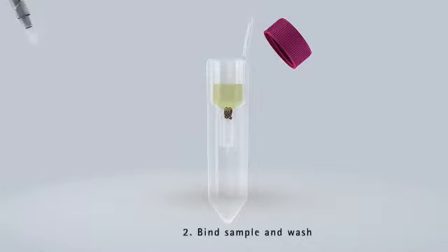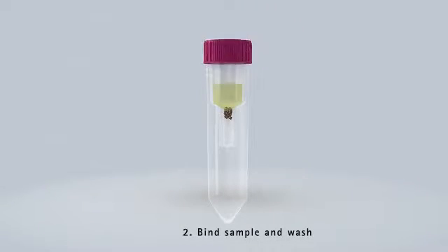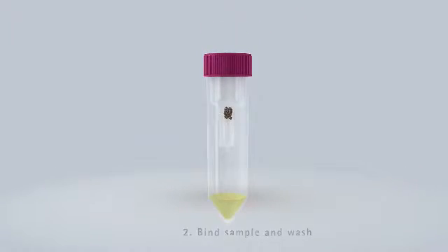Add your sample and incubate. Clear the unbound sample and wash the resin with one quick spin.